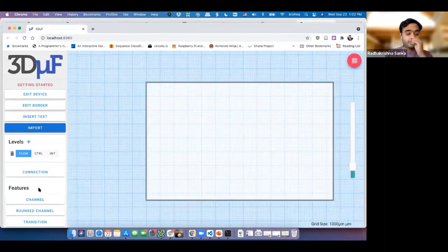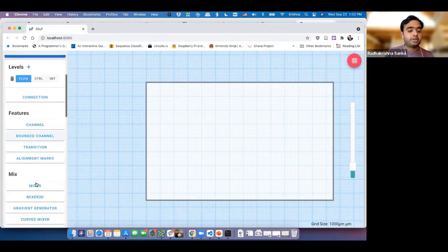Now, as you know, this is version 2 of 3DuF, and it's a beta version right now. So there are a couple of things which are slightly off and don't work exactly as the online version. But the reason we want everybody to contribute to this one is because we spent a lot of time over the summer refactoring the entire code to make it open source user friendly. What we realized with our older version of 3DuF was that it was very hard to add UI features and new workflows. So we used a UI framework called Vue.js to simplify adding new workflows, new functionalities and components, like UI components, not the design components. Even that has been simplified, to tell the truth.